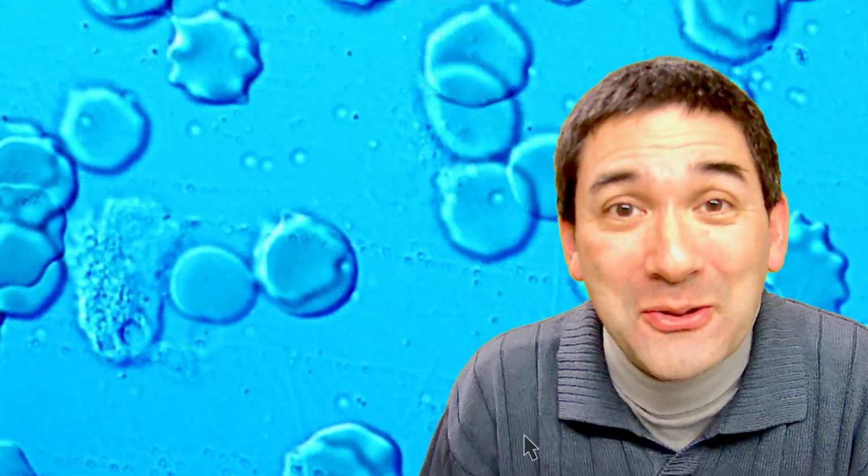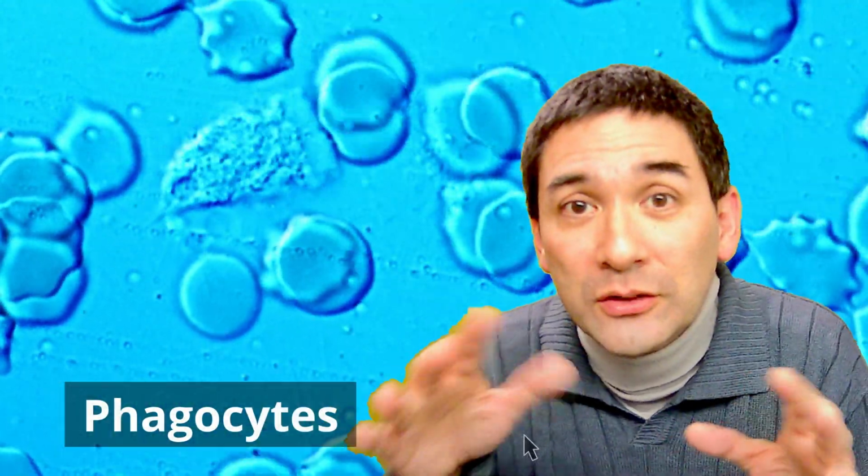And one way we're able to see over here. These are phagocytes, and what they do is they crawl around and they look for bacteria and other invaders and they start to engulf them. So basically they eat them up, and then those bacteria are digested away.